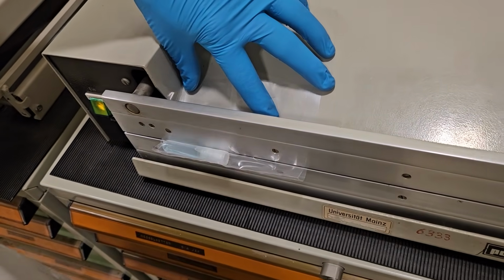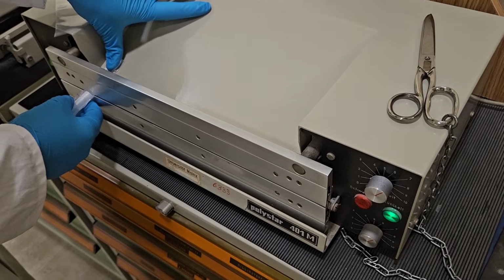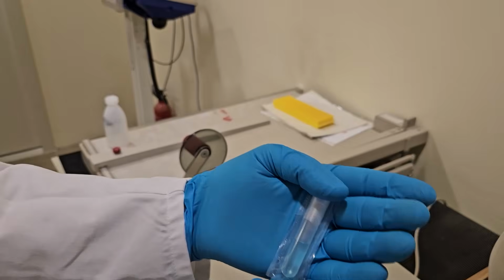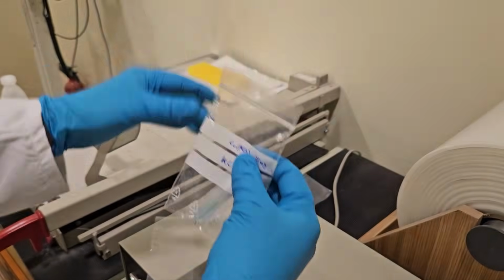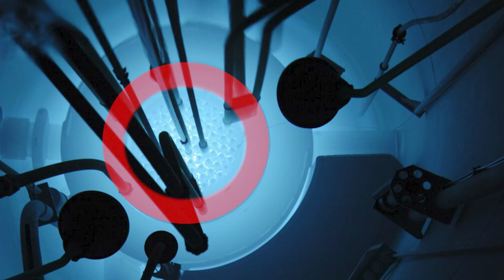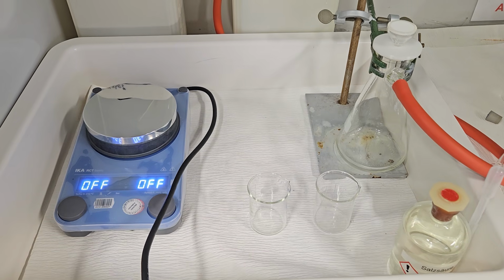Once the sample has been irradiated in the reactor's so-called carousel, the experiment can begin after a suitable decay period. Both the standard and the sample are irradiated in the carousel. Even if the neutron flux is not perfectly homogeneous, on average they receive about the same number of neutrons. Then let's get on with the experiment.